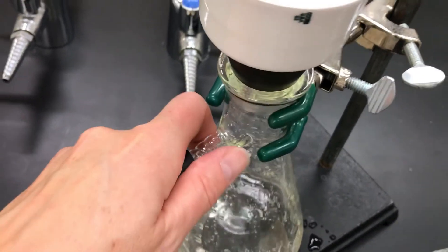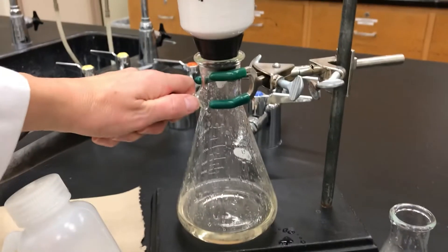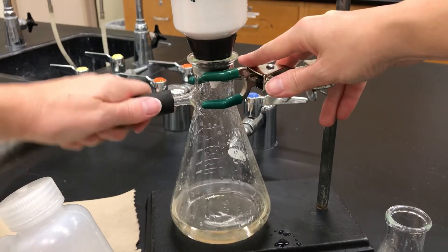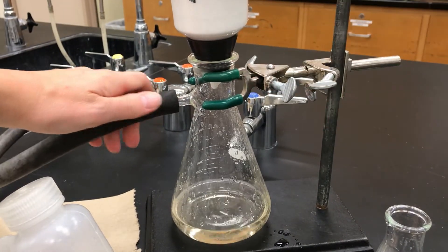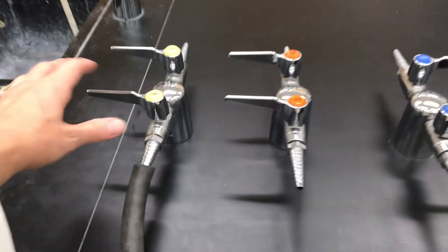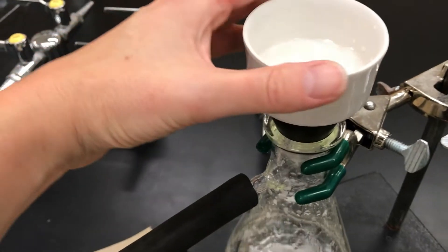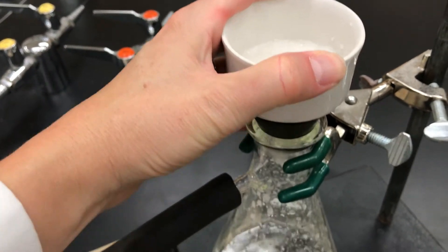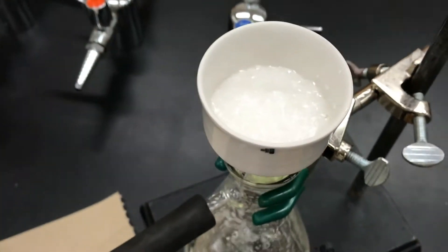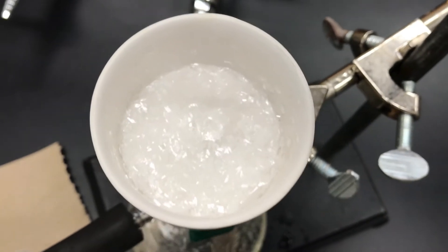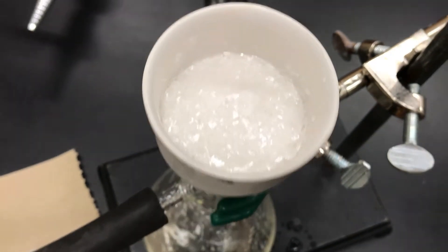After that rinse, add back your rubber hose. Turn on the vacuum. Push on the funnel to make sure it's a good seal and then have that drain out the rinse liquid. And keep that draining for at least a minute or so.